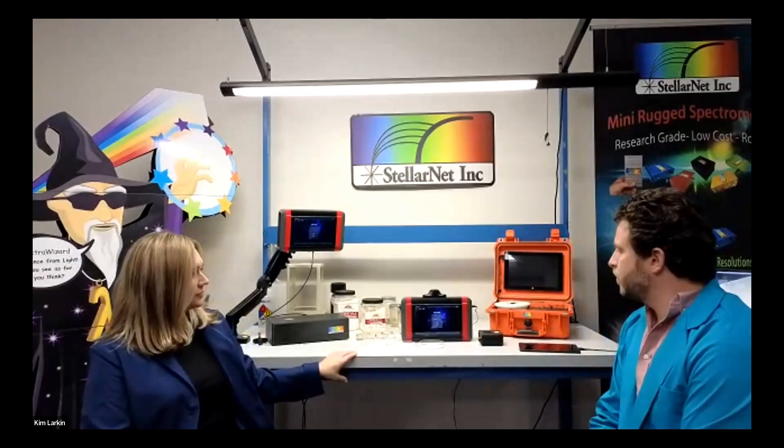In our previous video we showed you how to make a calibration model for milk powders. You can also measure different cheeses, cheese powders, butters, and so forth. We have some starter calibrations to help you out, but it's very easy to make the calibrations yourself. In this demonstration we're going to show you as if you are the technician — you do not need to have a PhD in analytical chemistry or know about chemometrics. Rather, you can just push collect and get the results on the screen, save your data, log it, and report.